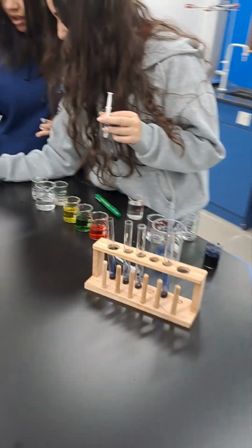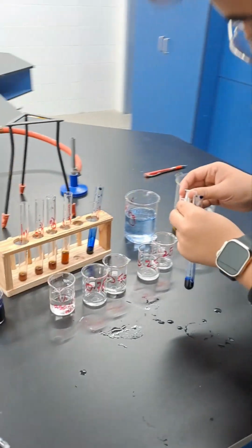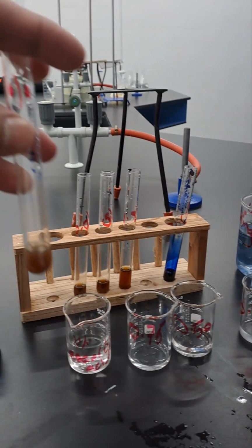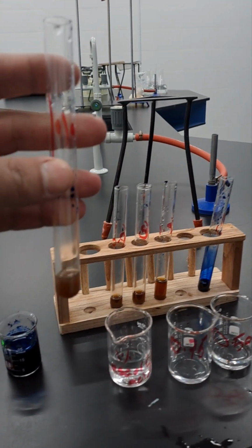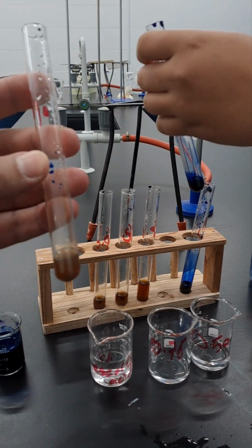Okay, did you try any concentrations? Not yet. Okay, did you try any concentration? Okay, so for example, this is the 1%. You added DCPIP first, 1 centimeter cubed, and you keep adding 1%. How many milliliters were used to change the color?